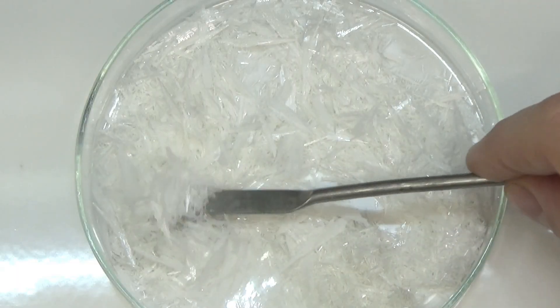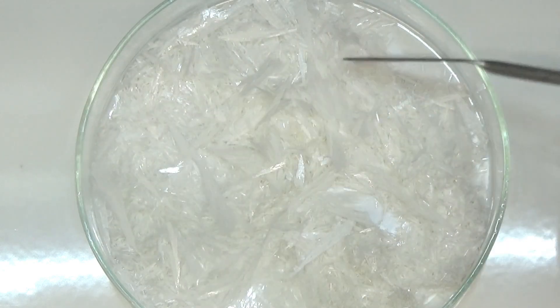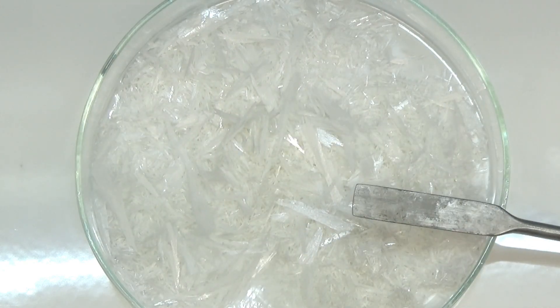The crystals are collected by suction and dried in an oven at 60 degrees for 12 hours. Crystals' white needles were obtained.